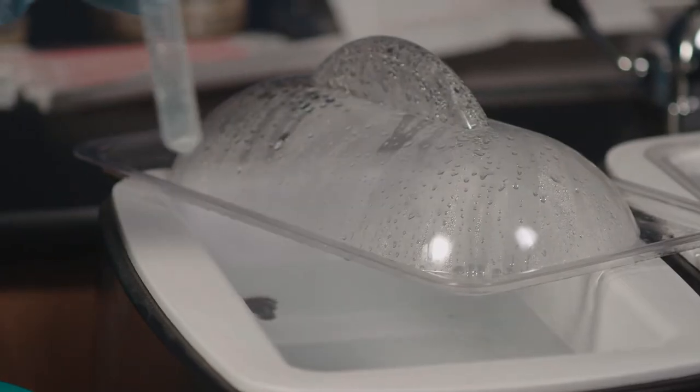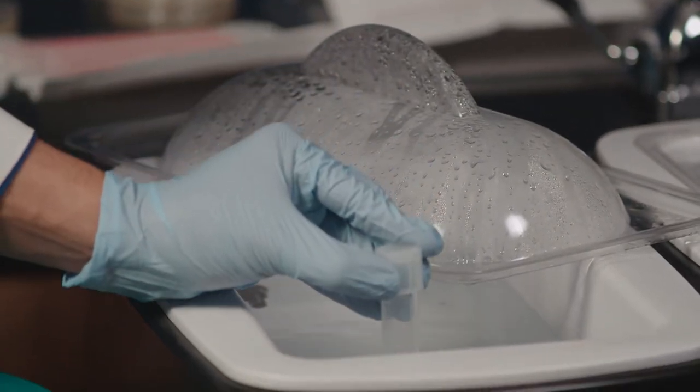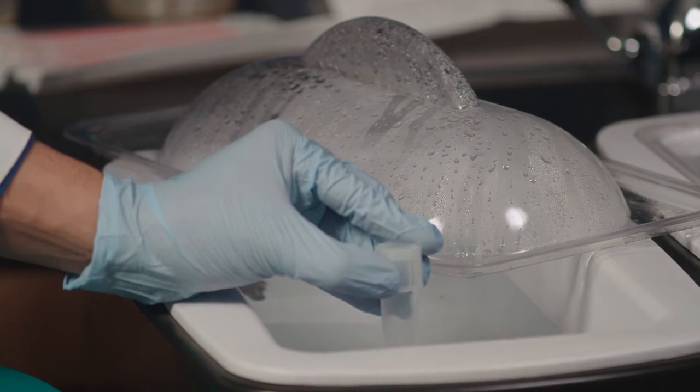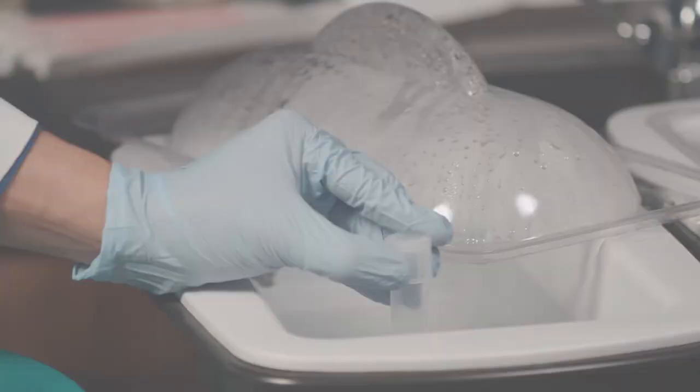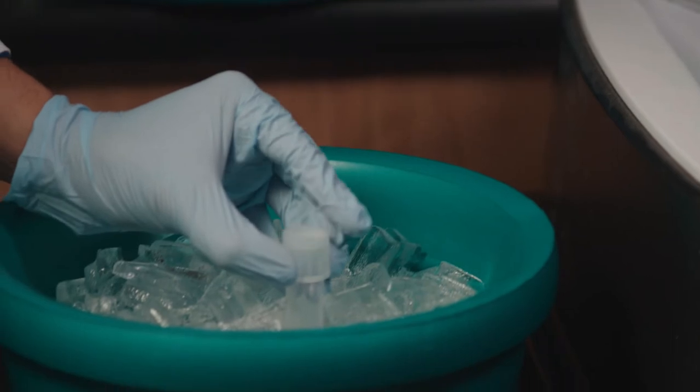Take samples from ice and immediately heat shock for 90 seconds. Immediately return the samples to ice.